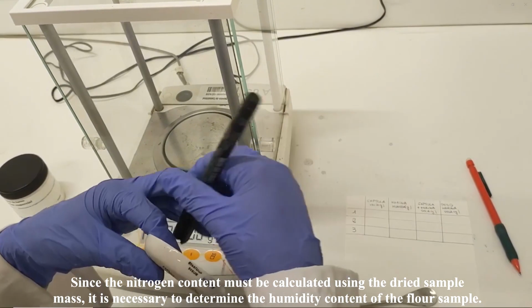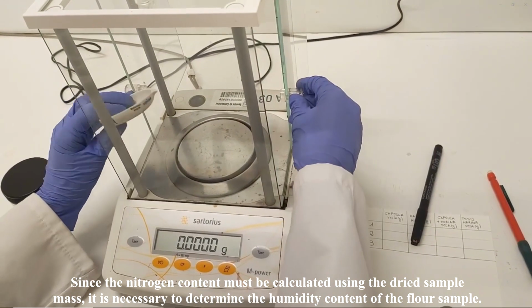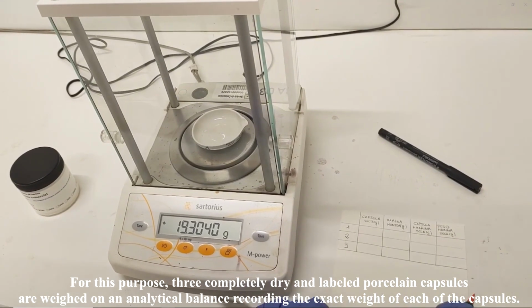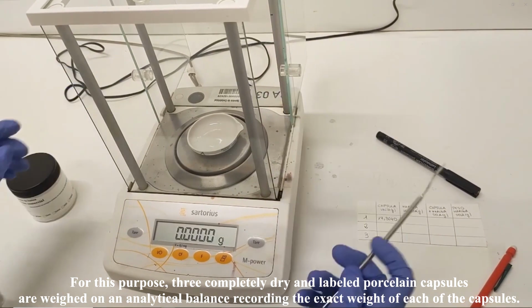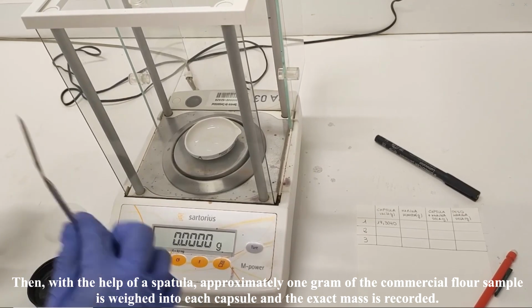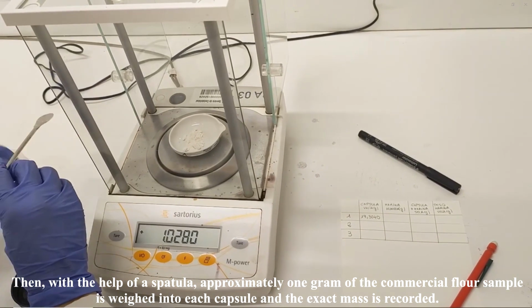Since the nitrogen content must be calculated using the dried sample mass, it is necessary to determine the humidity content of the flour sample. For this purpose, 3 completely dry and labeled porcelain capsules are weighed on an analytical balance, recording the exact weight of each of the capsules. Then, with the help of a spatula, approximately 1 gram of the commercial flour sample is weighed into each capsule and the exact mass is recorded.